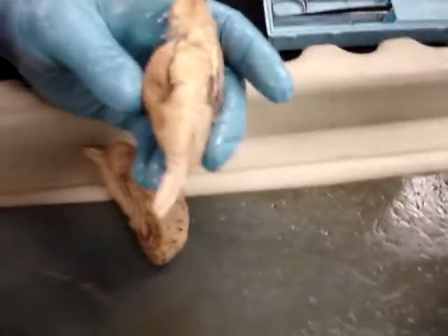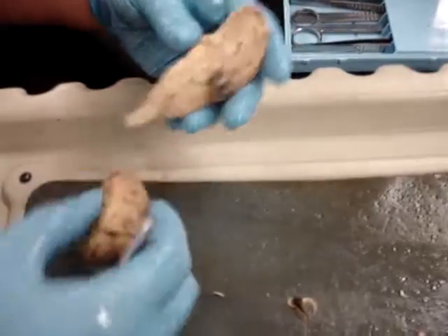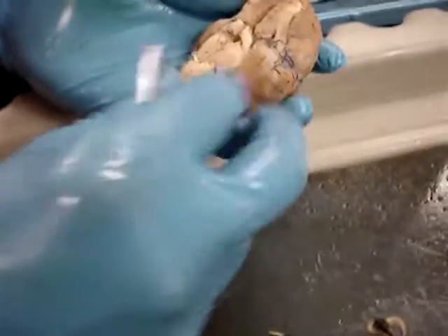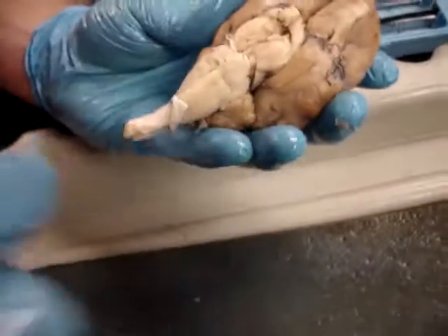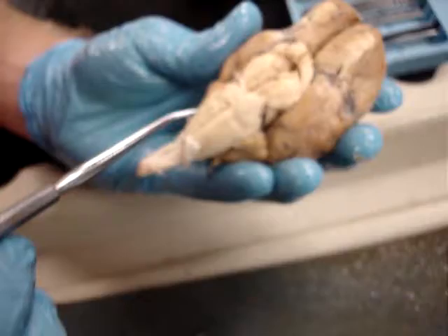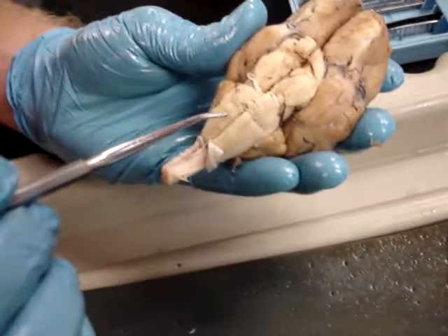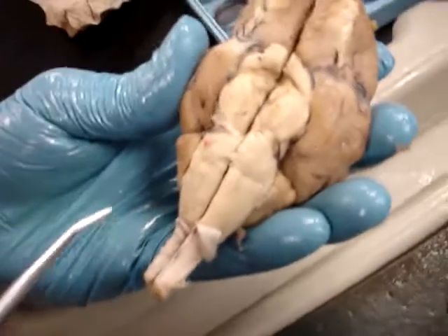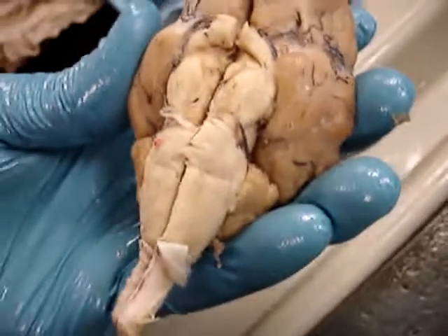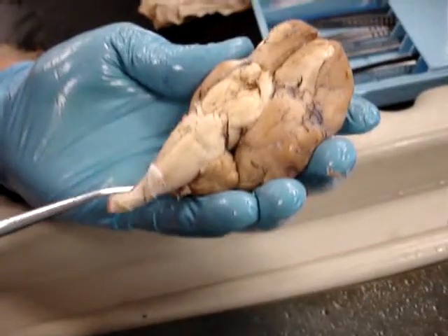The pons would be these two things. See how there's this kind of lateral section right here? Those are called the trapezoid bodies. And then this is the medulla oblongata.